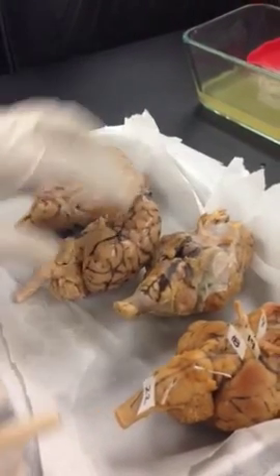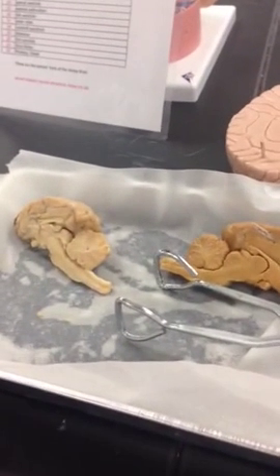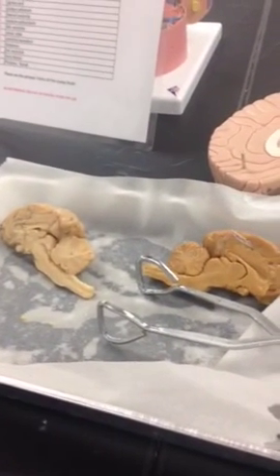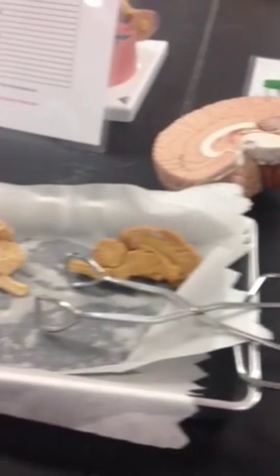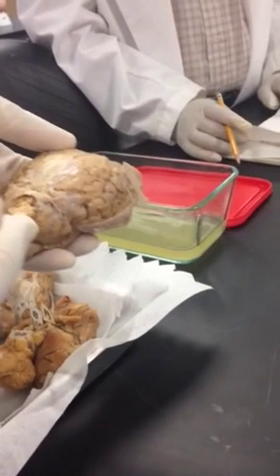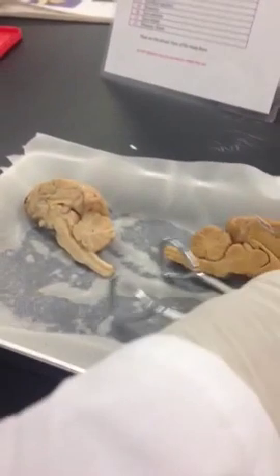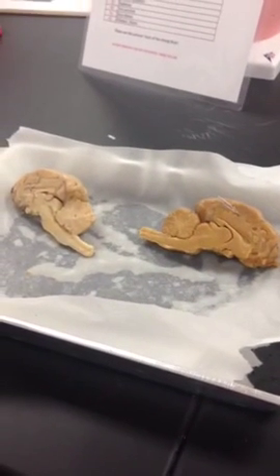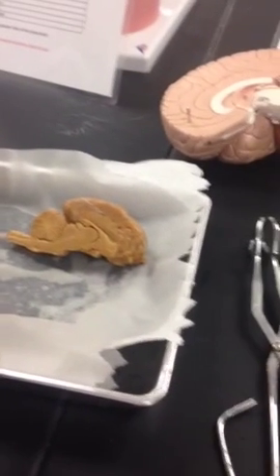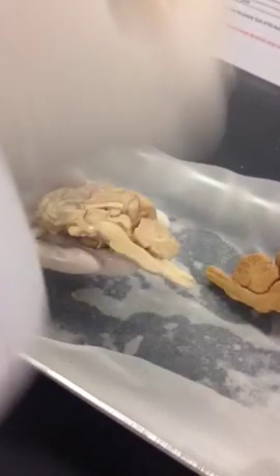Okay, now we can look at some more structures. If you take the next figure, figure 4 in your book, you can see the sagittal view or mid-sagittal view. So if you take the brain and pass a knife right across through the longitudinal fissure, through the cerebellum, then you'll get this half. So let's see the structures. You can use that figure if you like. Either you can use the sheep or human brain, it's all the same.